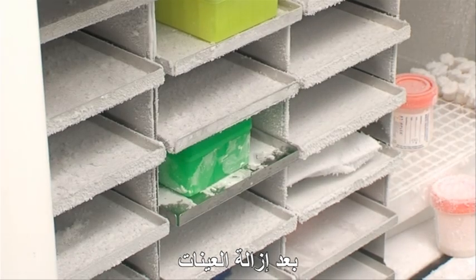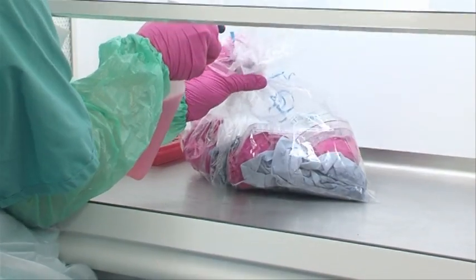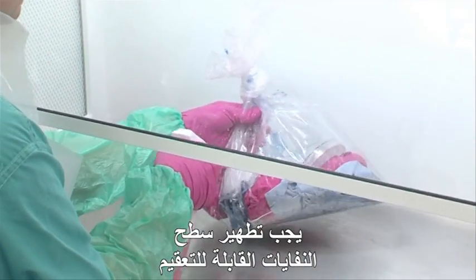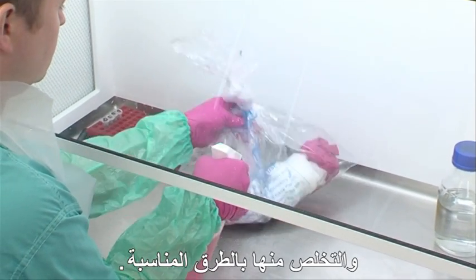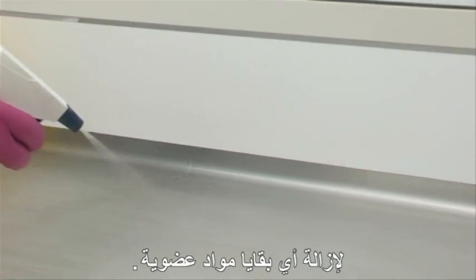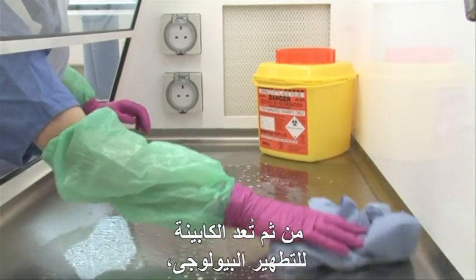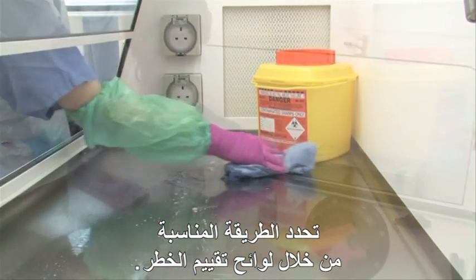Having removed the samples, you will need to clean and decontaminate the cabinet. Waste that can be autoclaved should be surface decontaminated and removed from the cabinet and discarded into the appropriate waste streams. All cabinet surfaces should be thoroughly cleaned to remove any residual organic matter. The cabinet can then be prepared for bio decontamination, with the appropriate method determined by risk assessment.